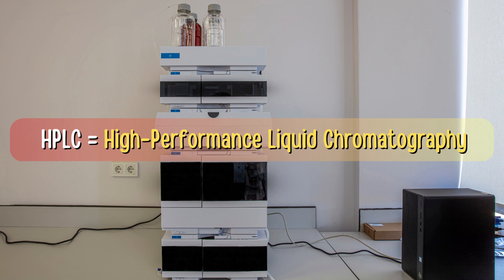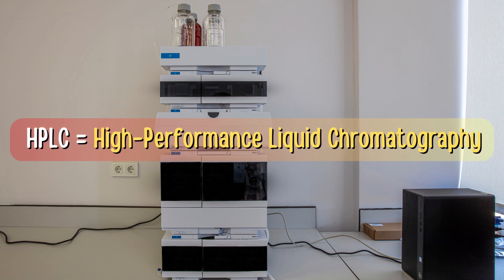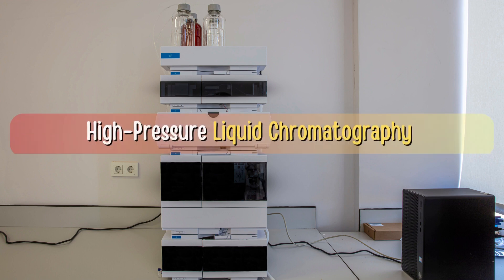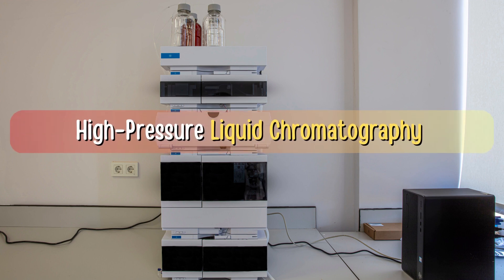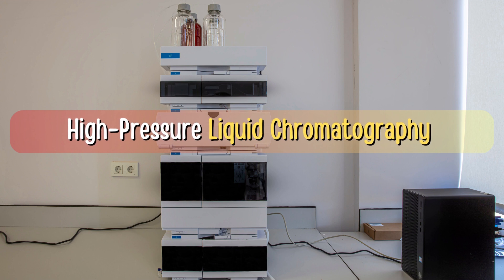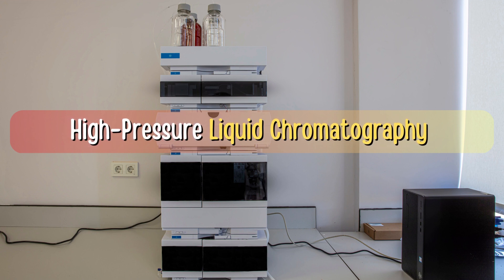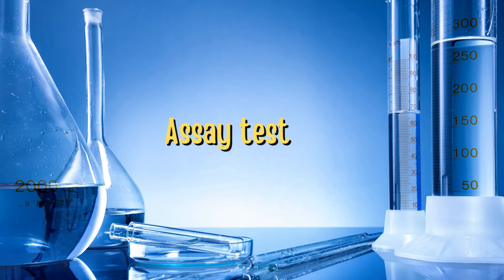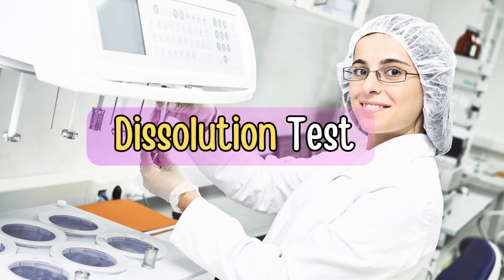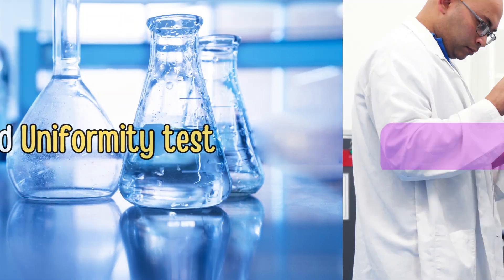Now coming to HPLC. HPLC stands for High Performance Liquid Chromatography, also known as High Pressure Liquid Chromatography. HPLC is a powerful analytical technique used in the pharma industry for testing the quality of products, for which different tests are carried out such as assay test, related substances, dissolution test, content uniformity, blend uniformity test, and many more.